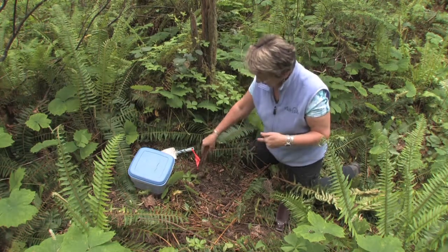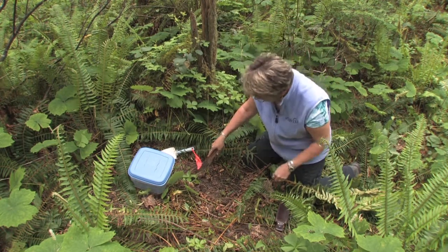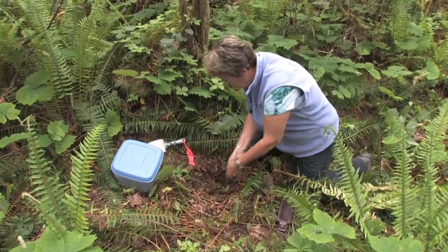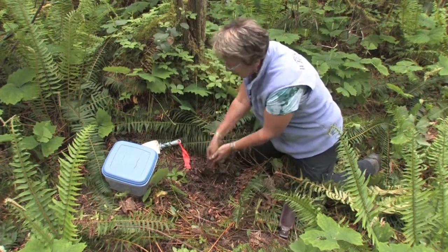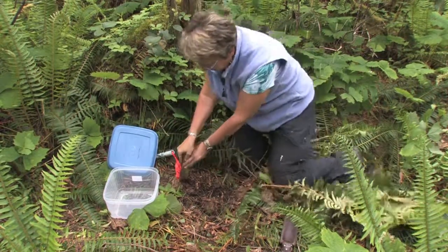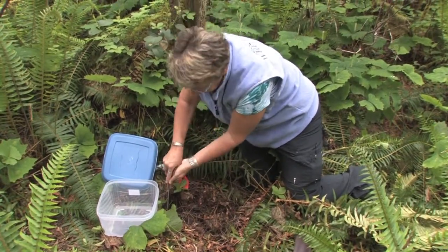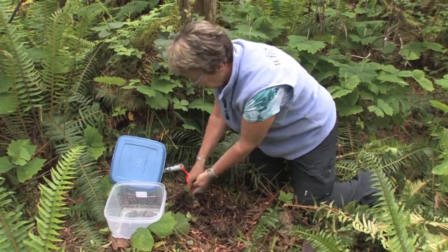In terms of forest harvesting, it's very important not to remove or damage the forest floor layer. What we do is take a 20 centimeter by 20 centimeter block of soil down to the top three centimeters of mineral soil, and we place this directly into a Tupperware box. Back at the lab it will be sorted by hand. One of the advantages of looking at soil fauna instead of soil microorganisms is that you can identify them by morphology.